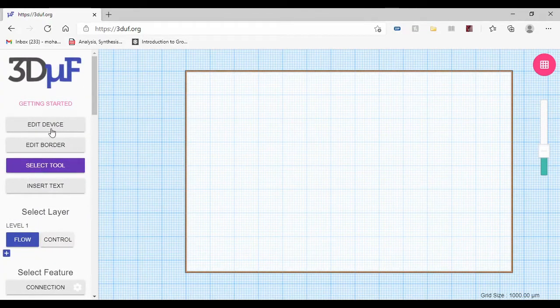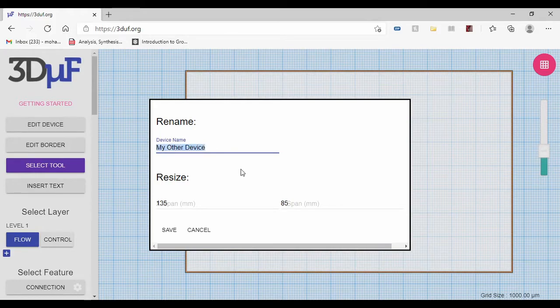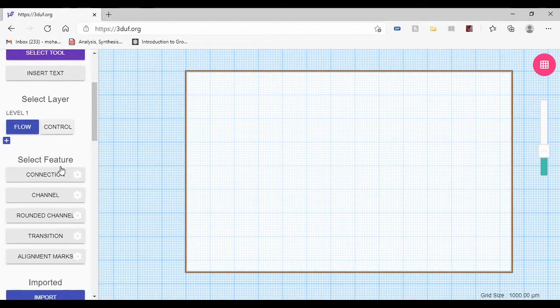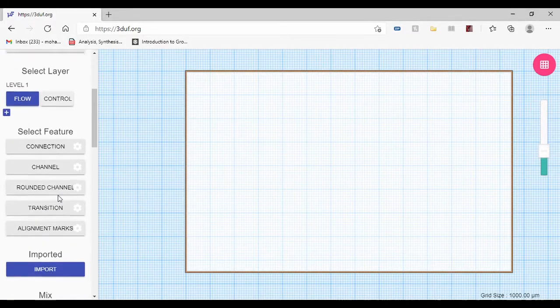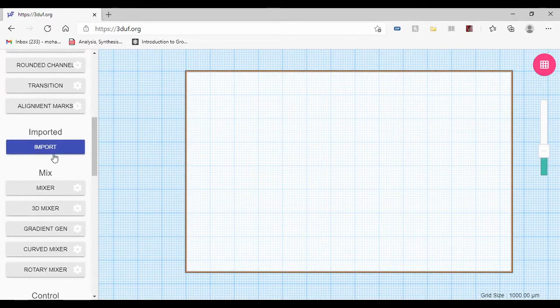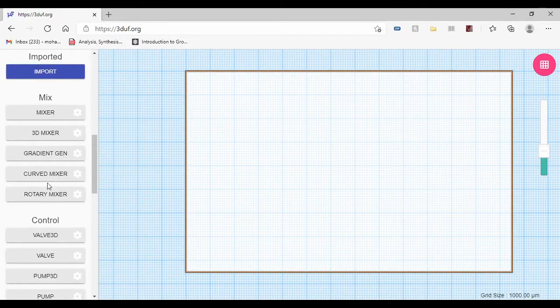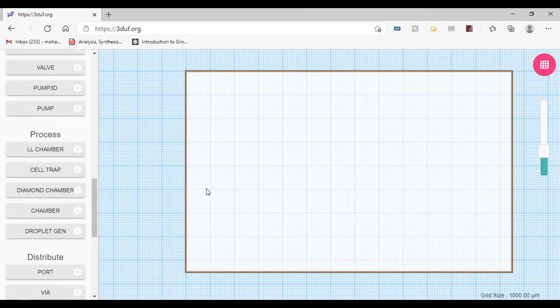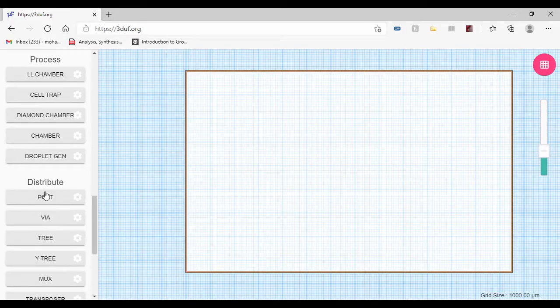So to start off with, you can change the name of your device here. You can change the size. And you can select features like connections, channel, and other stuff. You can import a design if you have one. And you can select certain tools that you can use in designing your microchip.